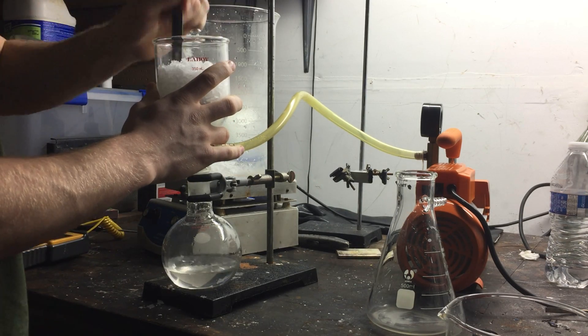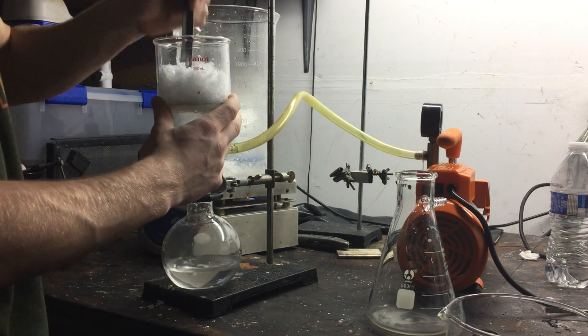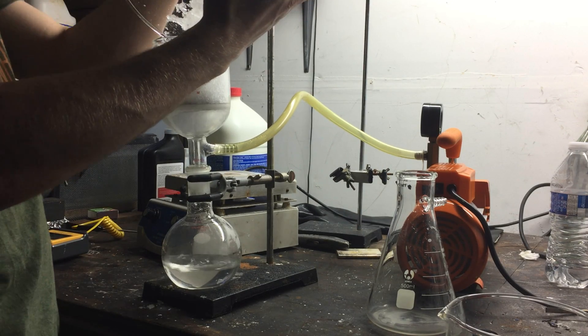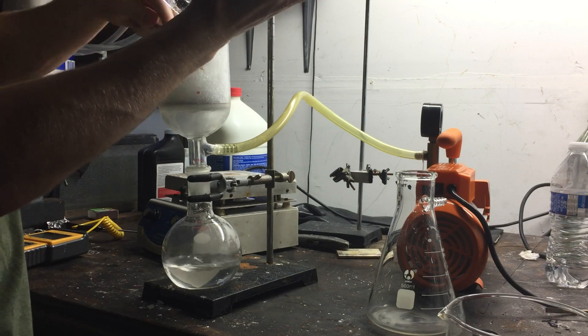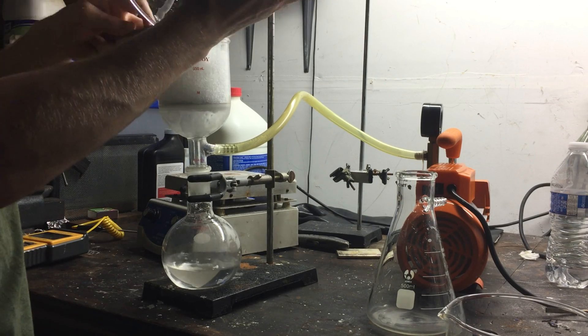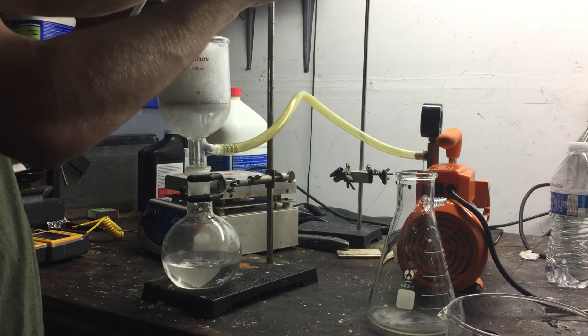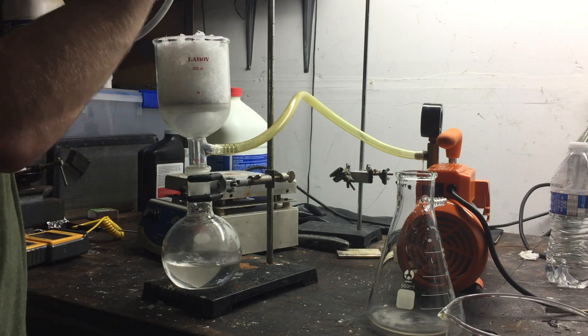This final crystallization will decrease the yield in the end, but it'll also improve the purity of our product, so it's definitely worth it. The solution that we're filtering off should contain all traces of the ammonium chloride, the potassium chloride, and any unreacted ammonium nitrate.